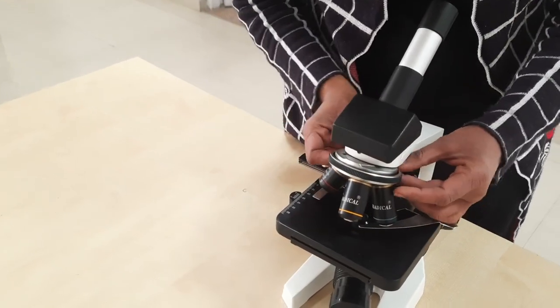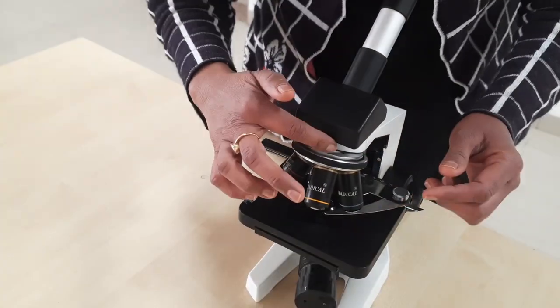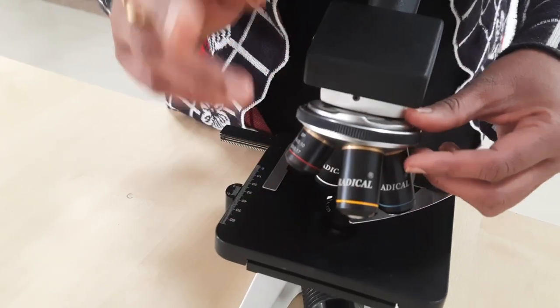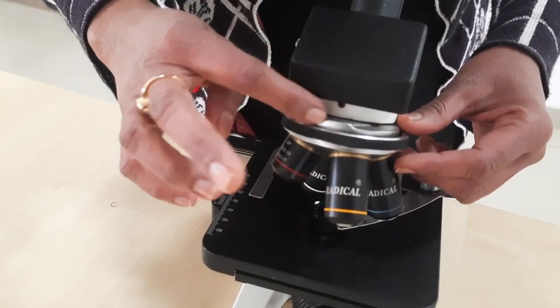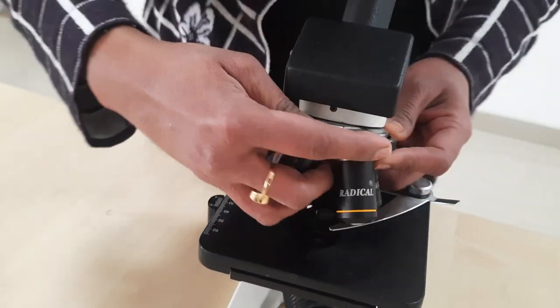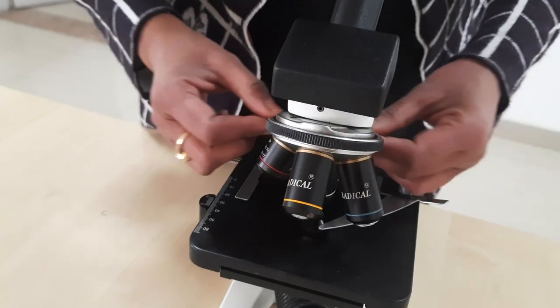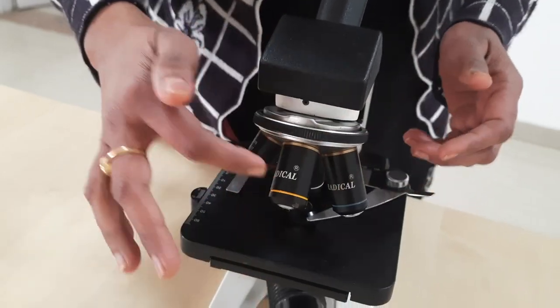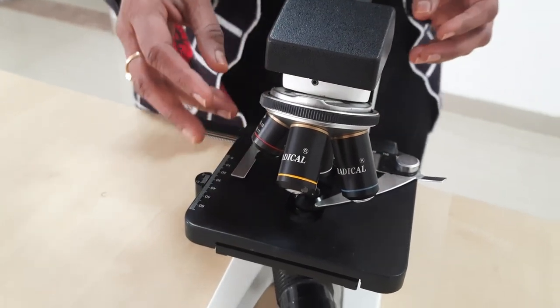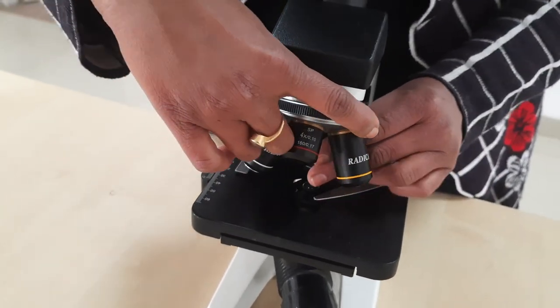There is also a nosepiece — the circular disc you can see here. The nosepiece is of two types: the upper fixed nosepiece and the lower revolving nosepiece. The revolving nosepiece holds or lodges the objective lenses. You can see there are four objective lenses.